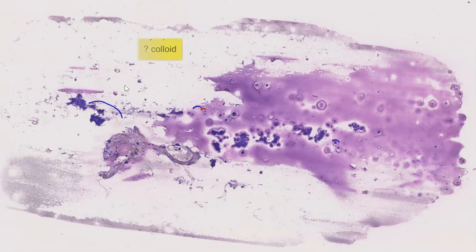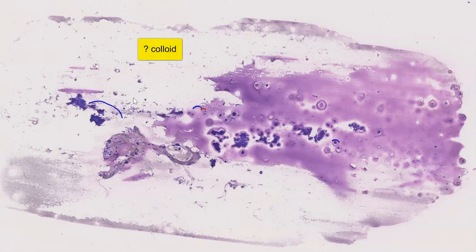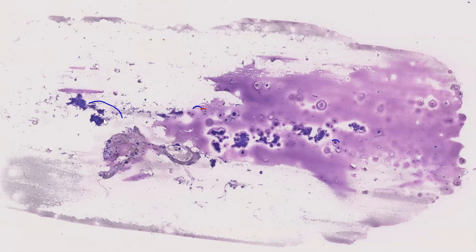And whenever we see these in thyroid aspirates, we always wonder whether it was colloid that had slipped off during staining.